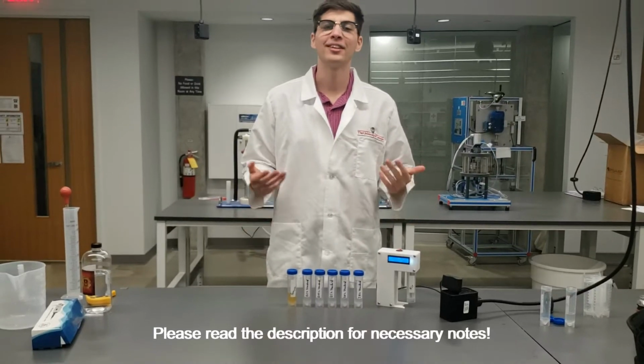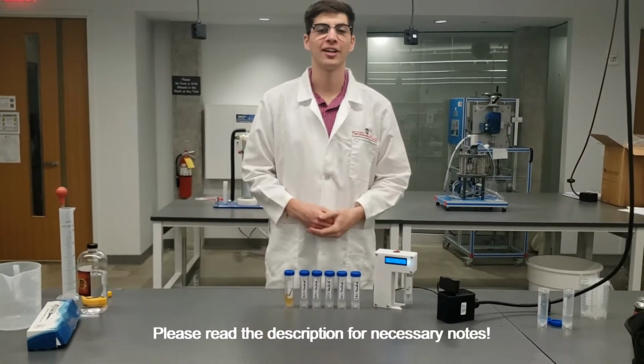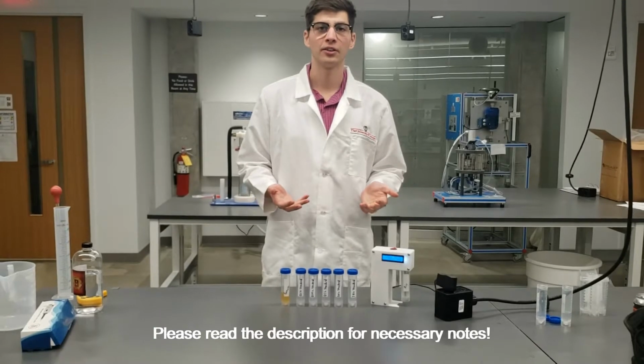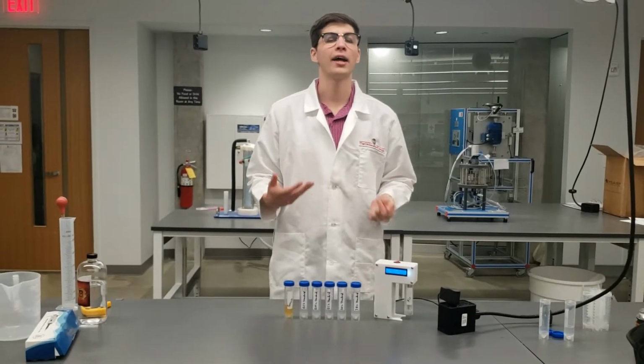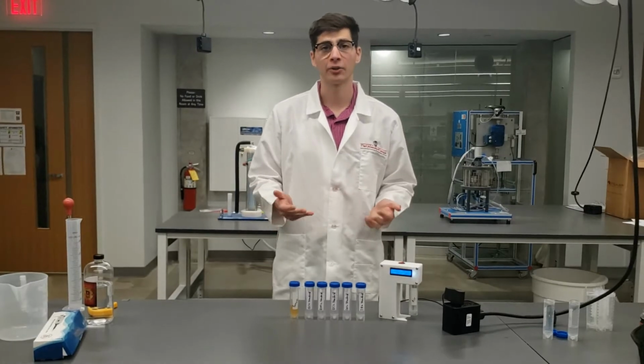Hey everyone, my name is Nick Robertson, founder of Rare Combinations LLC, and today I'm going to be telling you how to use your alcohol percentage detector in the most accurate way possible by creating your own calibration curve.